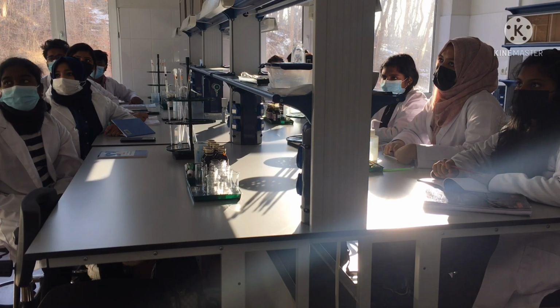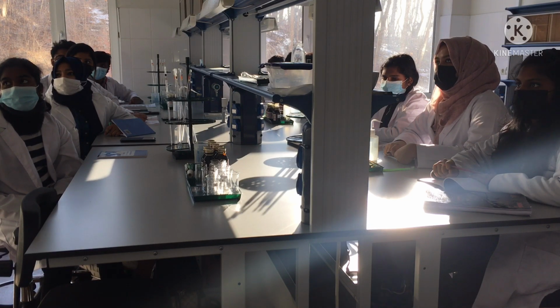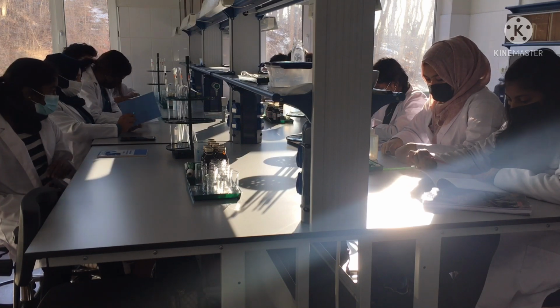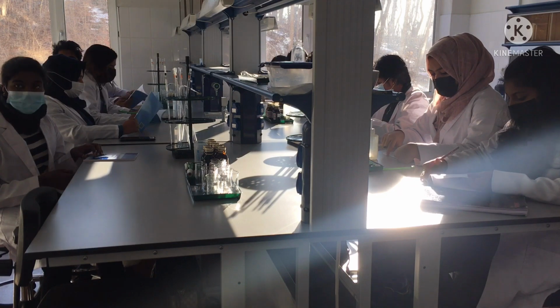So we will study the influence of the catalyst, and in the last series we will study the influence of different temperatures. We will make the first experiments at room temperature, and in the last series we will try to make it at low temperature, about 0, and at high temperature, about 40 degrees Celsius. And we will estimate the time to finish this reaction. In the manual you can see a lot of theory that you need to make the calculations. But now we will study our practice part.